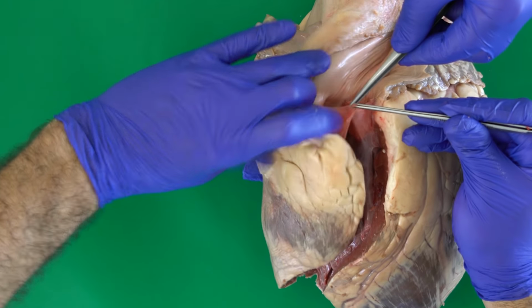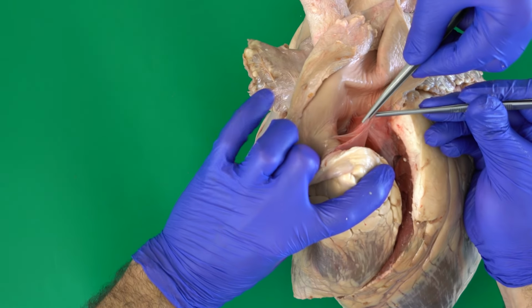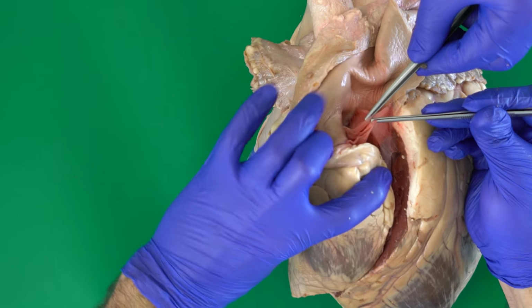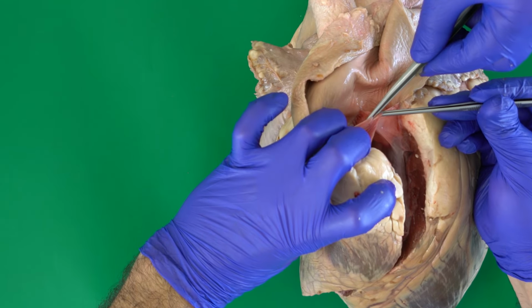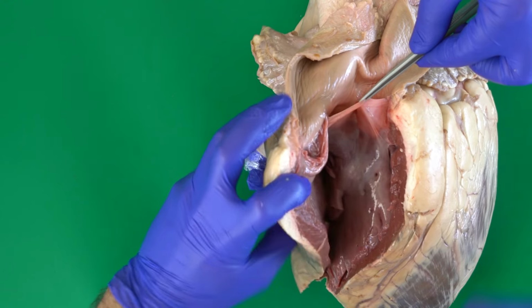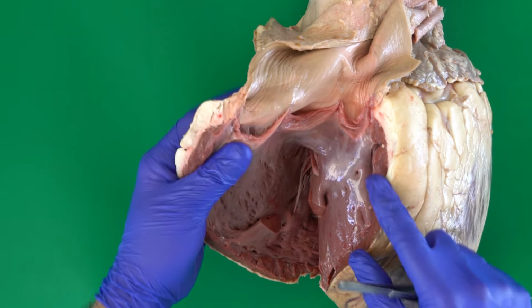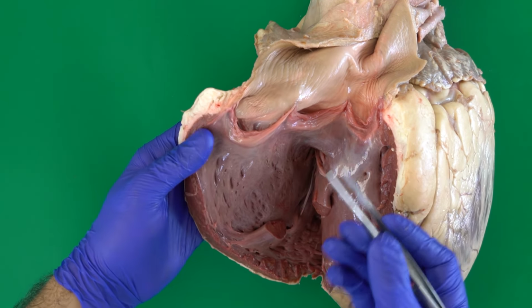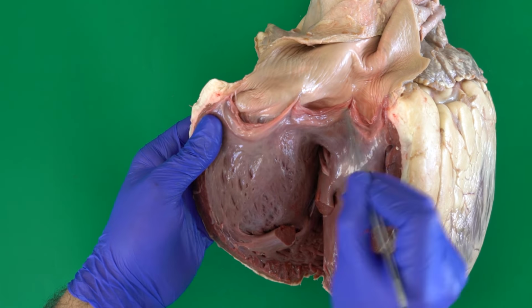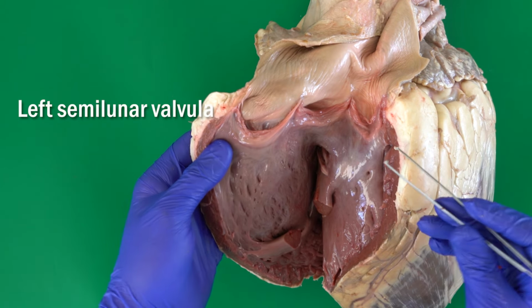So, as you can see here, the blood will fill these pockets, these semilunar valvula, completely, and there's no way for the blood to go back from the pulmonary trunk to the right ventricle. What is the name of these valvula? We have three of them inside, to form this valve.